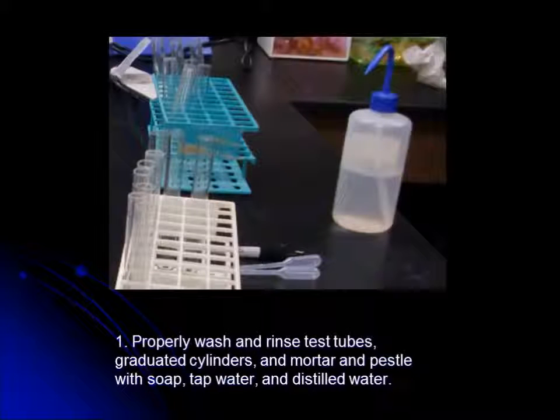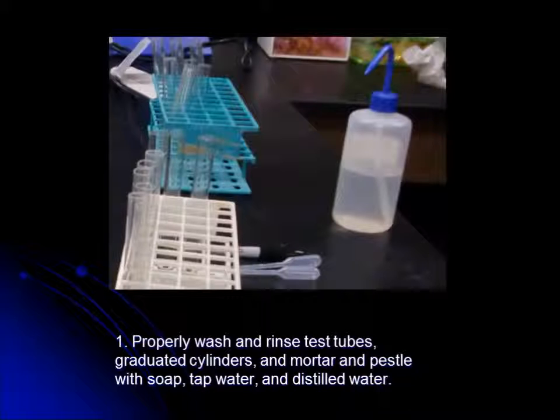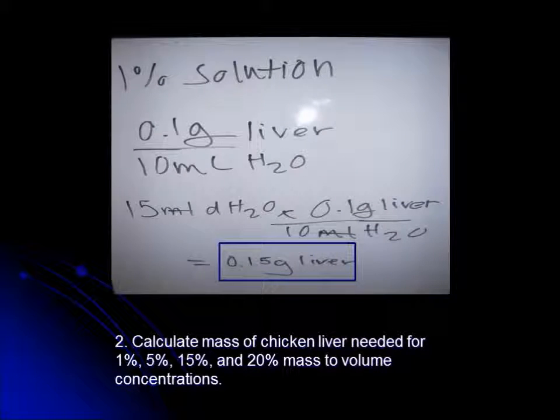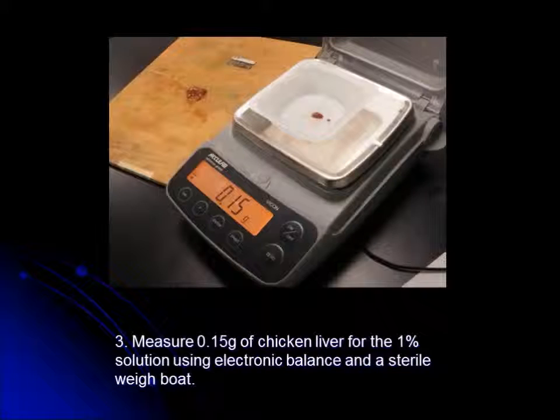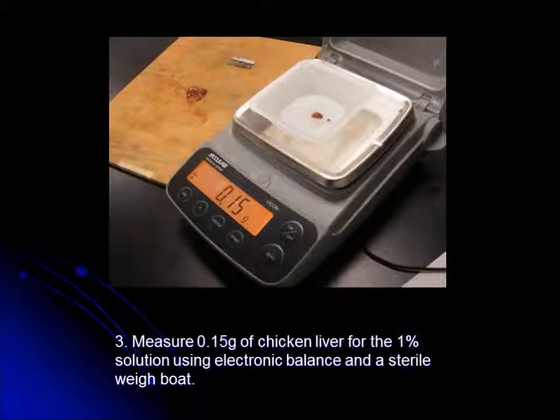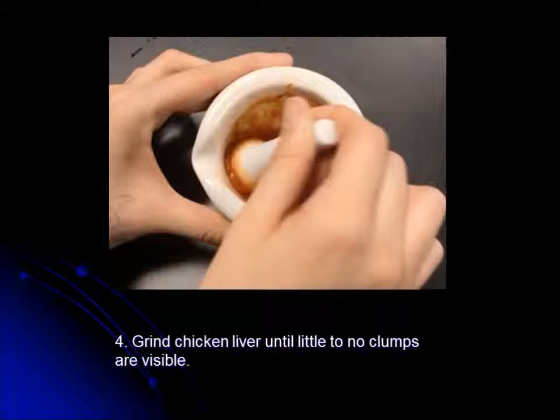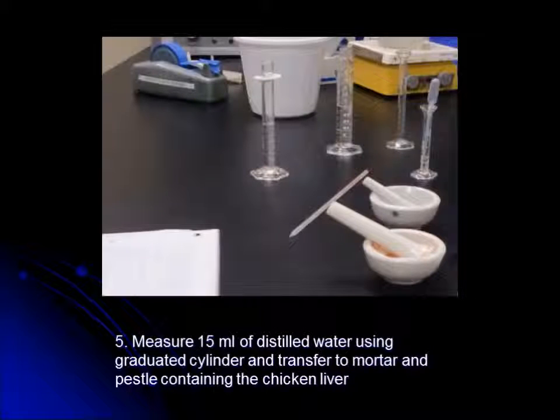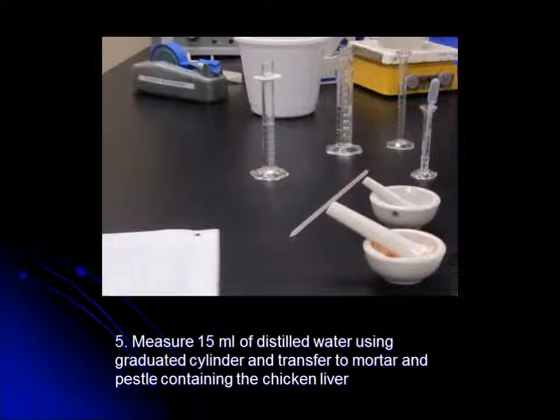Step 1: Properly wash and rinse test tubes, graduated cylinders, and mortar and pestle with soap, tap water, and distilled water. Step 2: Calculate the mass of chicken liver needed for 1%, 5%, 15%, and 20% mass per volume concentrations. Step 3: Measure 0.15 grams of chicken liver for the 1% solution using an electronic balance. Step 4: Grind chicken liver until little to no clumps are visible. Step 5: Measure 15 mL of distilled water using a graduated cylinder and transfer to the mortar and pestle containing the chicken liver.